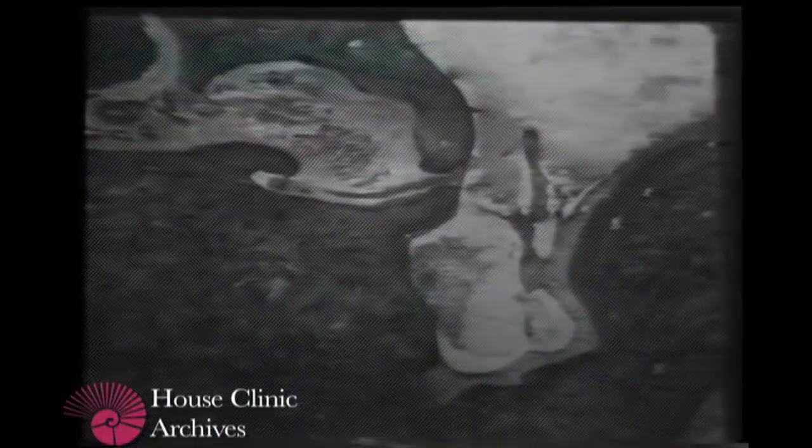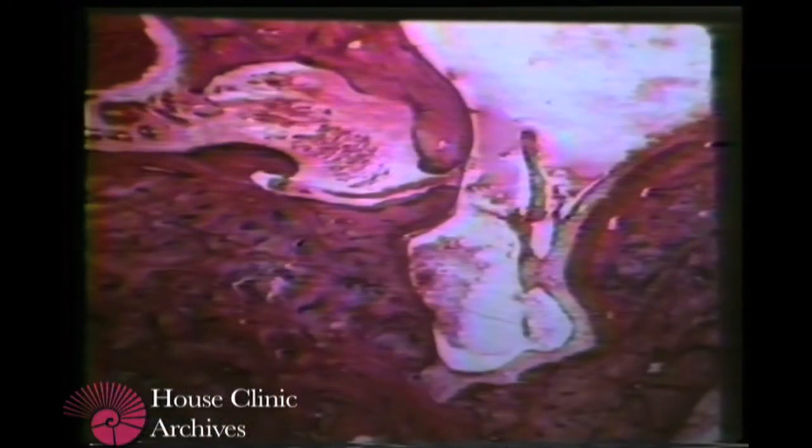In this normal temporal bone, the tympanic sinus is very deep. Fortunately, in most chronic ears, the inflammatory process prevents complete pneumatization, and here we see a very small tympanic sinus. Here is the stapedius muscle and the facial nerve.